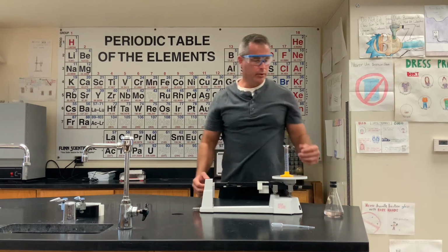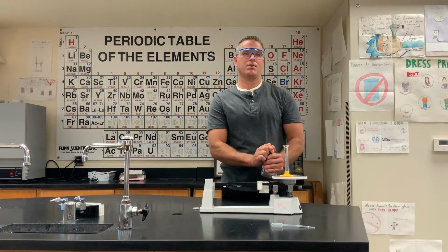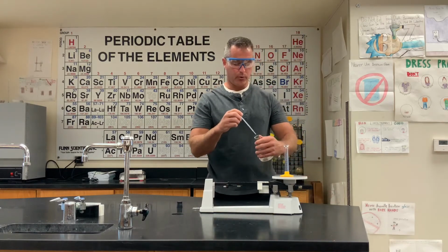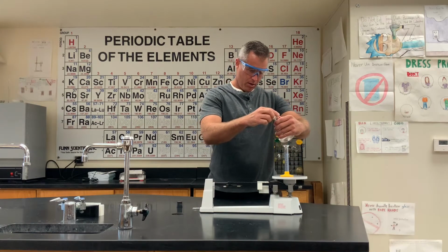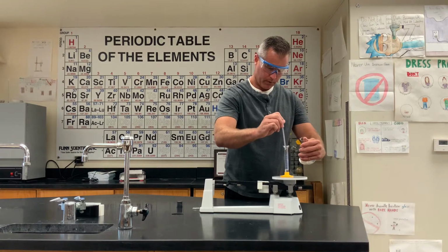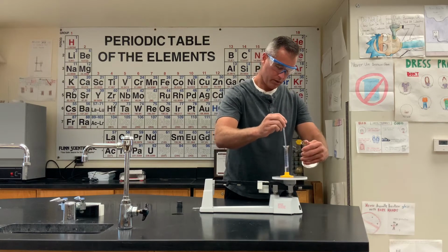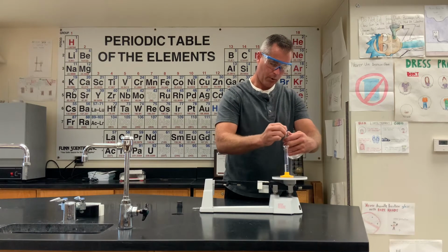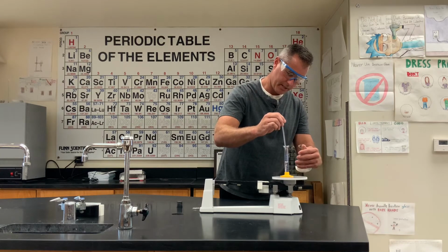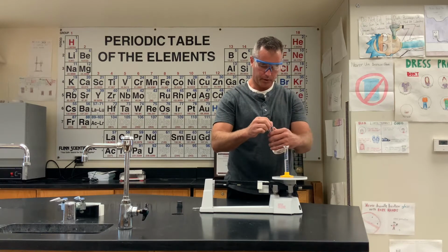Now I'm going to take this unknown liquid and add it to the grad cylinder. And don't worry about the numbers right now, we're going to put them on the board for you. Mr. Moore and I are going to get it all right before we send you to do it. Now one of your jobs is going to be to figure out what this unknown liquid is based on its density. So I'm going to be as accurate as I can be to give you good numbers.